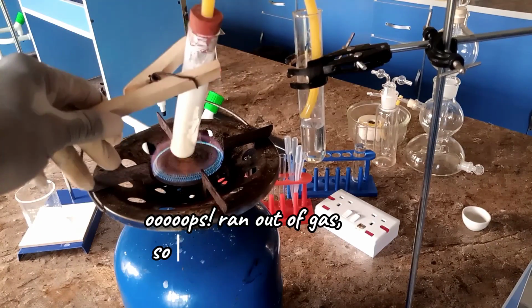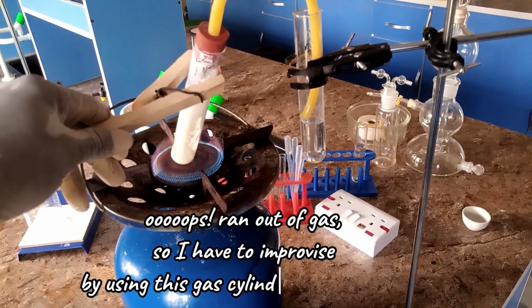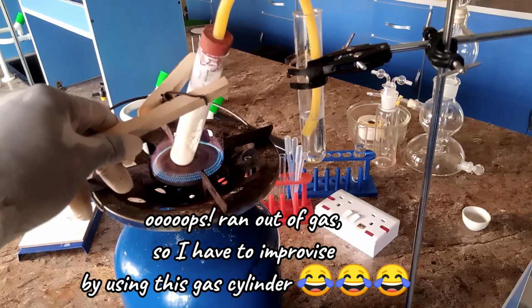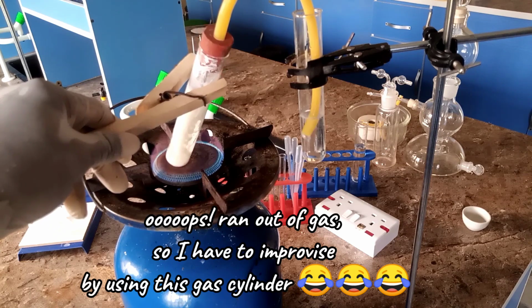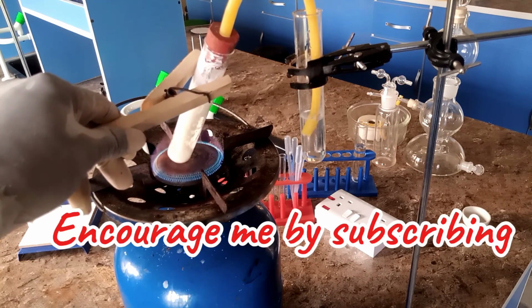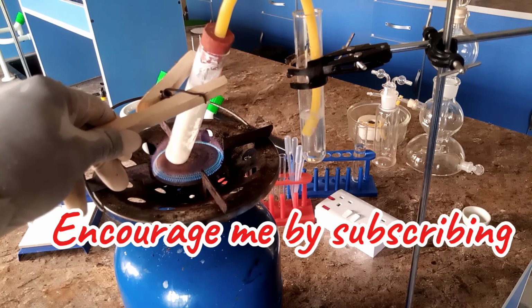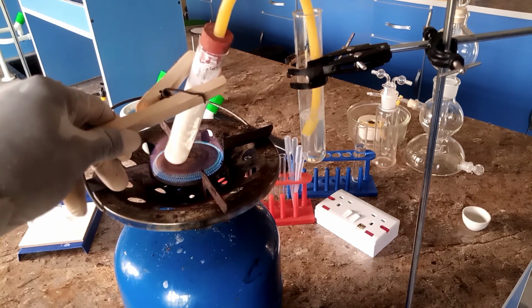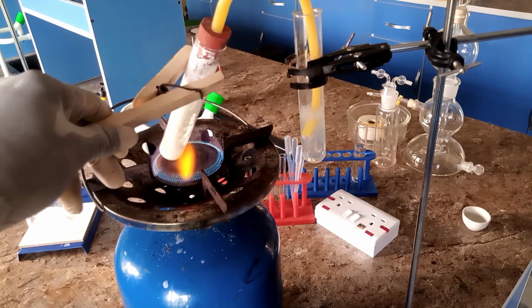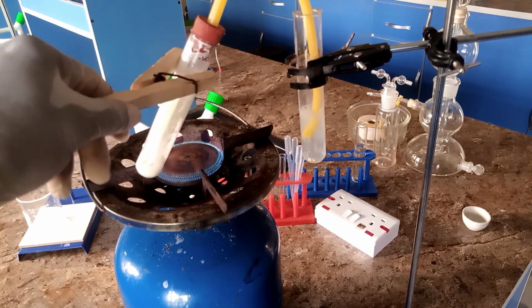So you have to heat the residue strongly to give off the carbon dioxide gas. So when you heat the residue, the lead carbonate decomposes to give you carbon dioxide gas, which is passed through the lime water. And you observe the lime water start changing to a milkish color, as you can rightly see in the video.